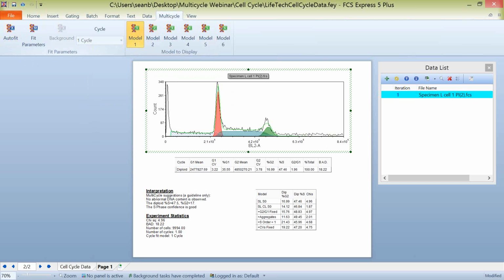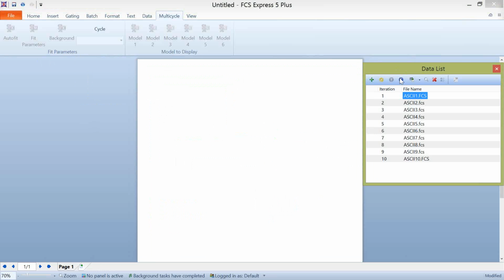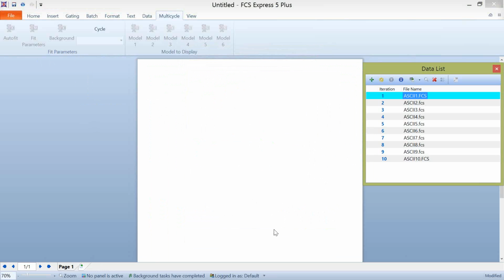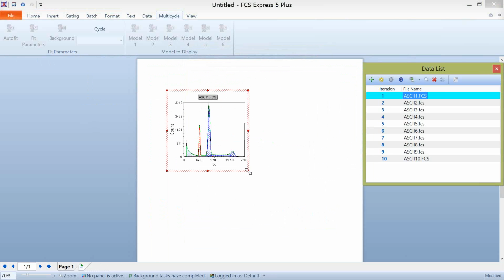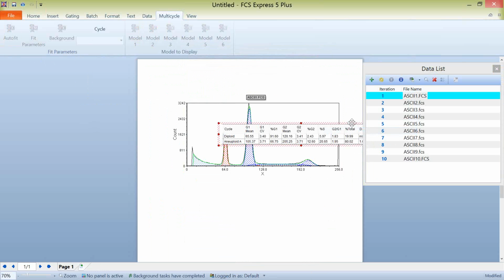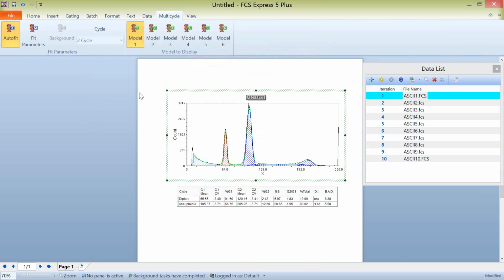And to show you how that works in FCS Express, I have a series of data that I've opened up here in our data list, and I'm going to insert a plot, a multi-cycle DNA plot for this data, and we'll see what Multicycle does. So I'll expand this plot type a little bit. I'm going to show our DNA cell cycle statistics. And you can see that with this particular plot and with this particular data file, Multicycle has determined that a 2-cycle fit is best for this data. There is an aneuploid population in here that it's determining. You can see that we've located our G1 and our G2 means for both the diploid and aneuploid populations.